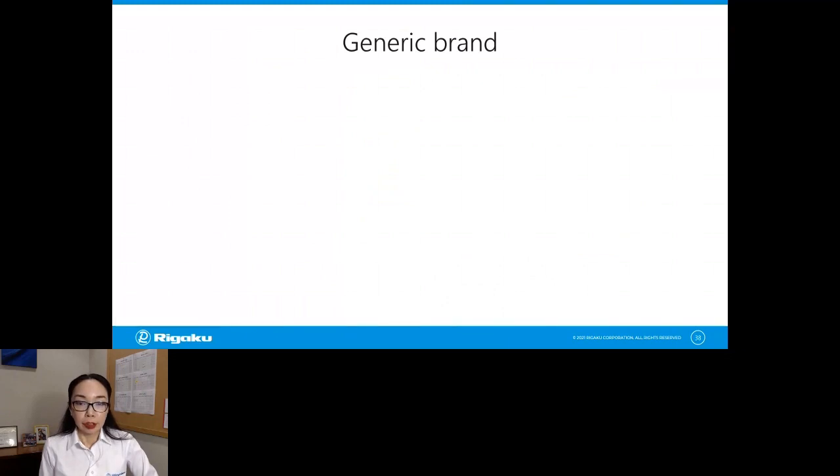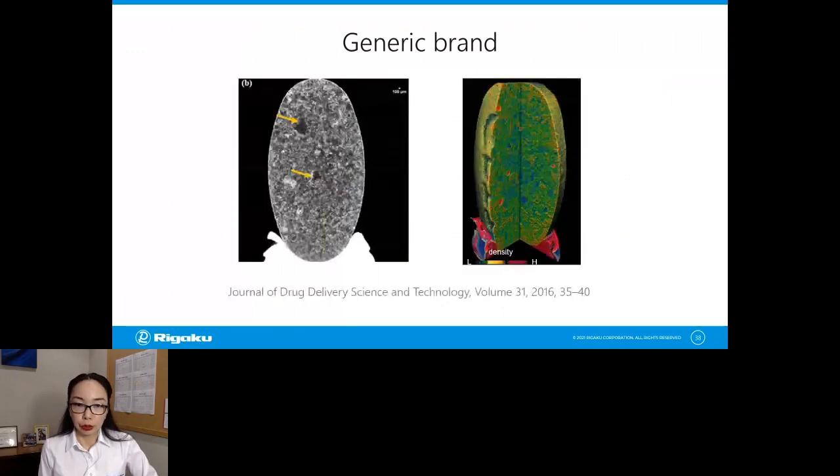But if you do the same experiment on this generic version, this is what you get. So you see a lot of large areas that are either dark or light. The dark areas are pointed out with the yellow arrows. And this tiny dot at the corner, this is a 100 micron scale bar. So you can see that those dark gray areas are millimeter size aggregates. Okay, so no wonder this tablet is so slow to dissolve. And this is something you can easily see when you do an X-ray CT scan. But if you grind those tablets to figure out what's going on, you might miss something like this. So this is an example of a dissolution curve study.